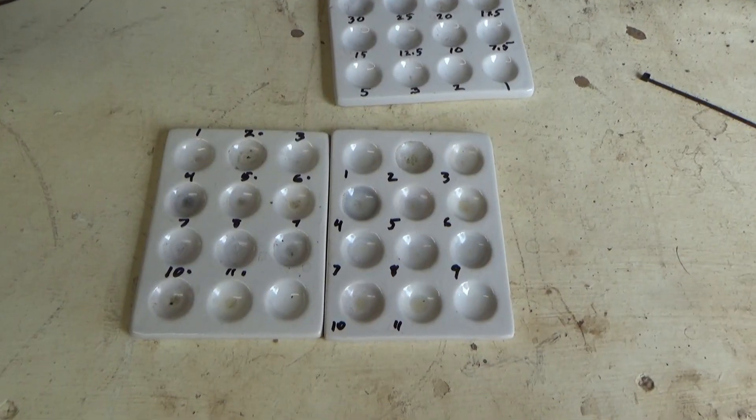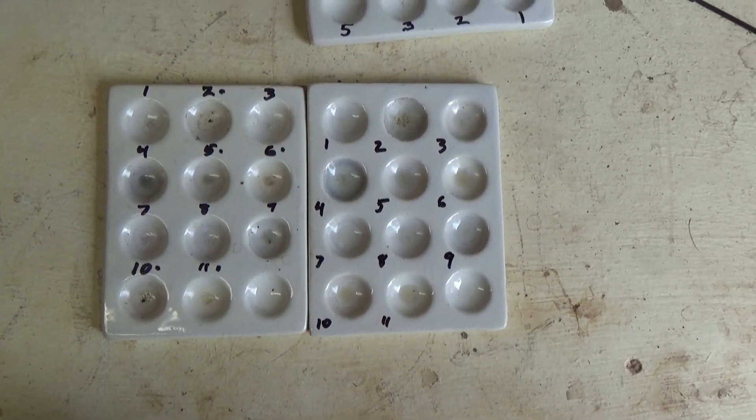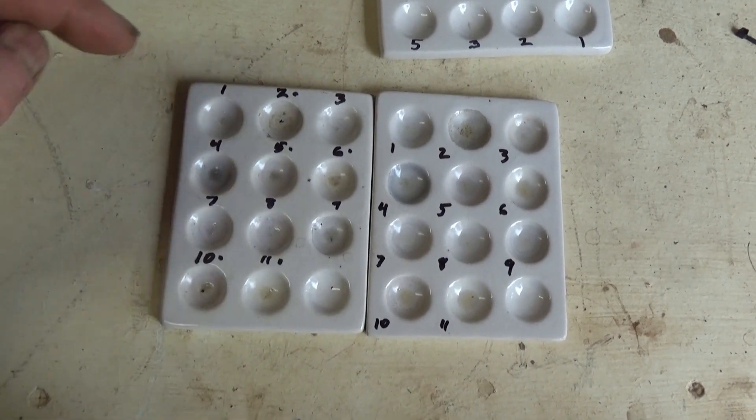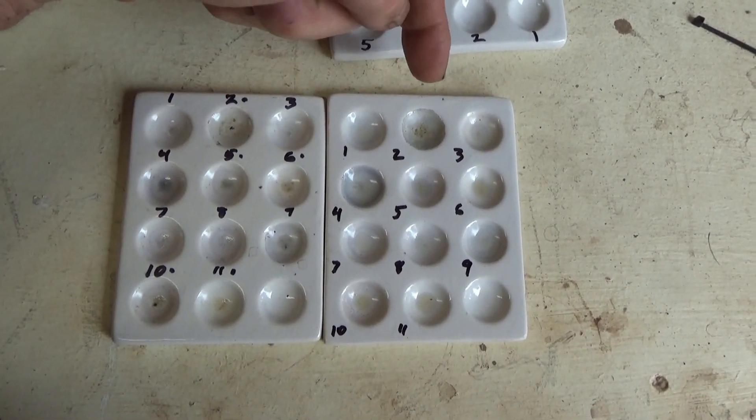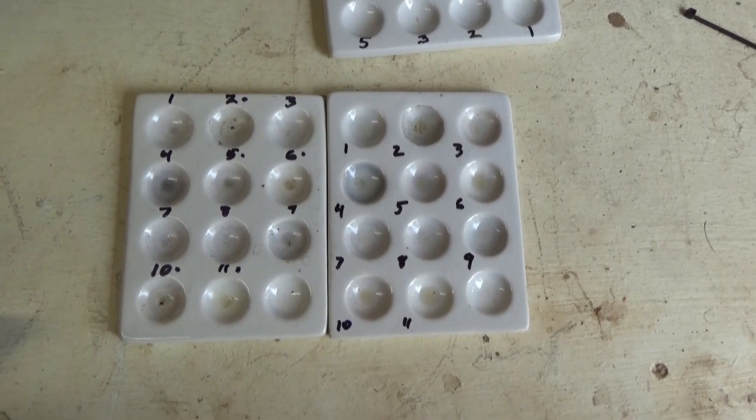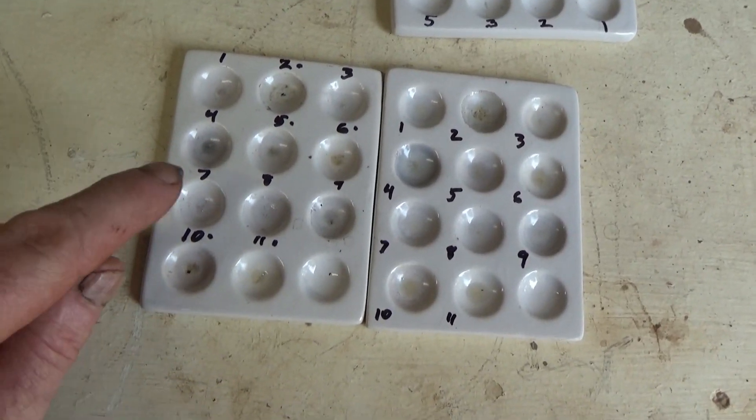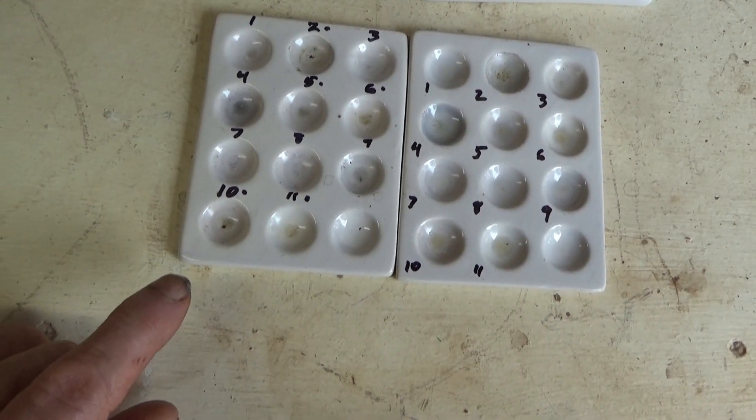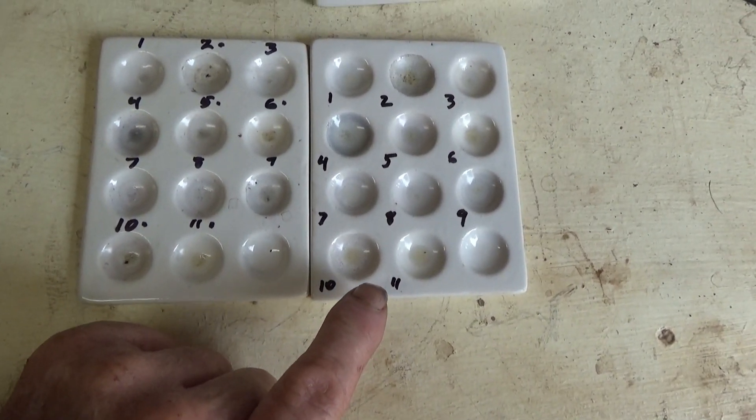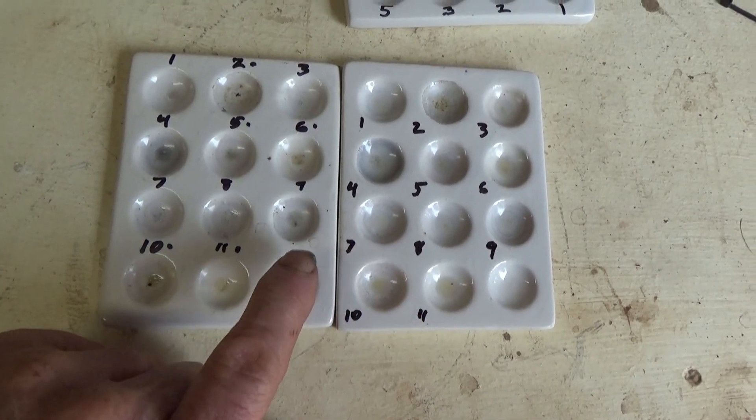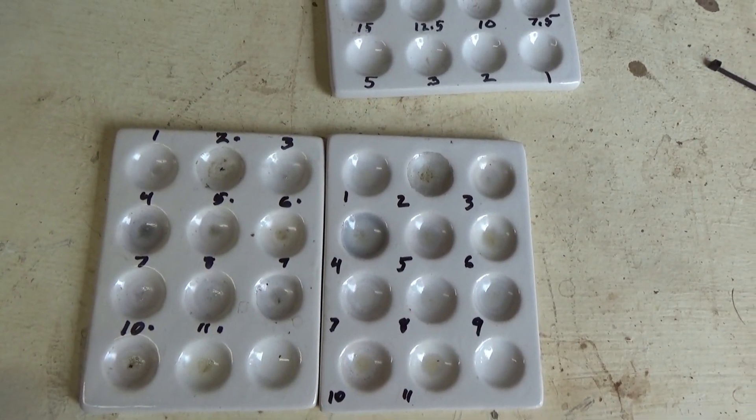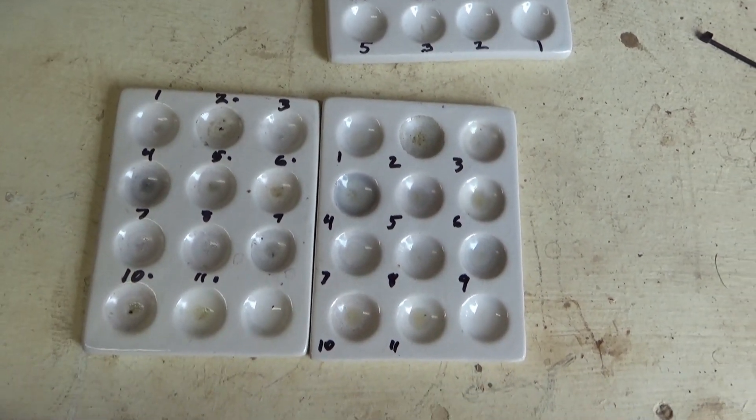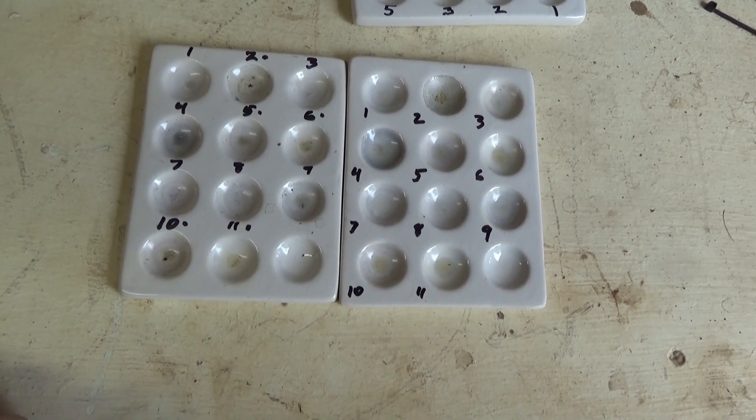Okay, so we've taken the two sets. This was the blow dried one, this is the just countertop dried one, and you can see there's a big difference in exactly how it dries. But I don't really see a great deal of difference in the actual results here. They look, some of these are somewhat different, but in general fairly comparable.